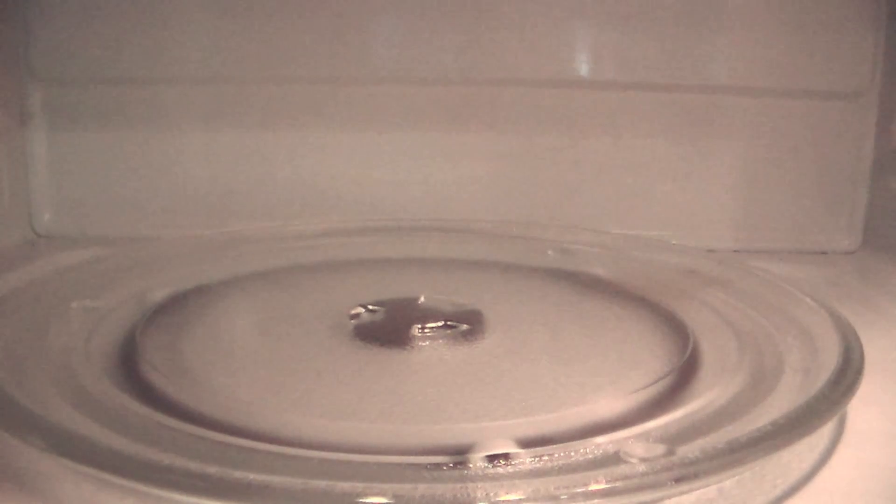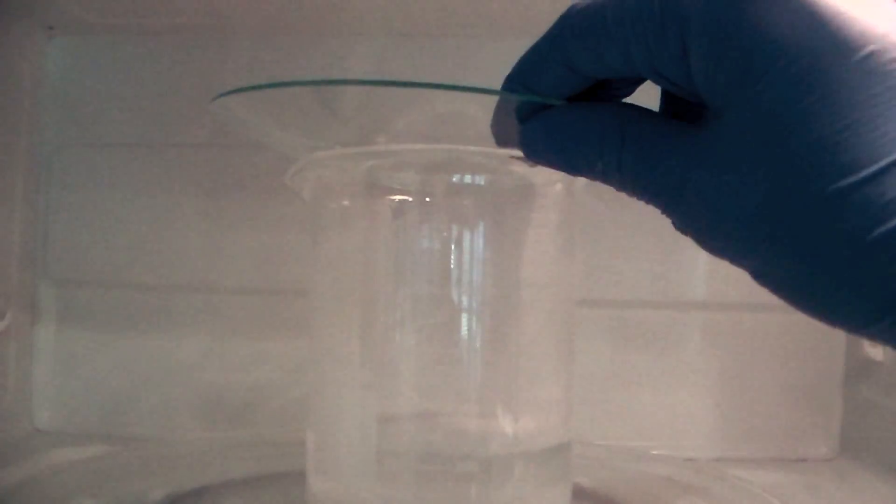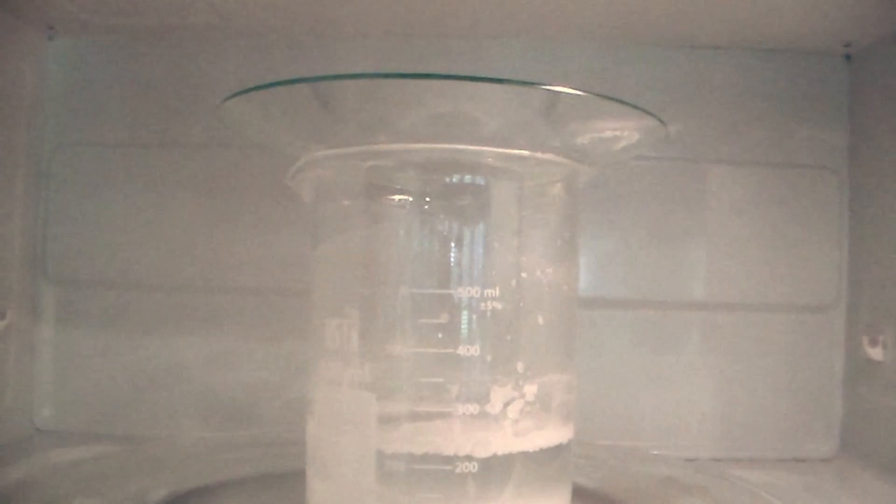So the beaker was placed in a microwave with a watch glass on top to prevent splashes. It was then microwaved for a couple minutes until all of the powder had dissolved.